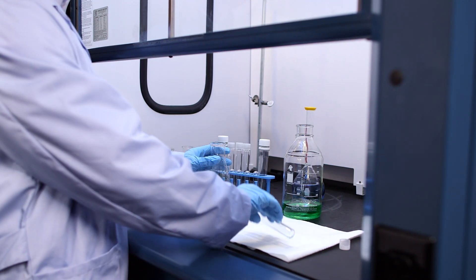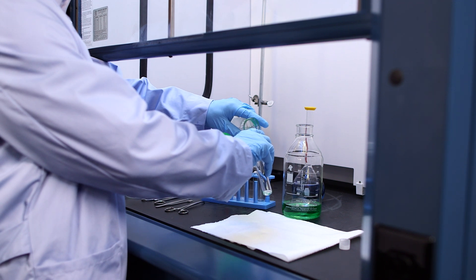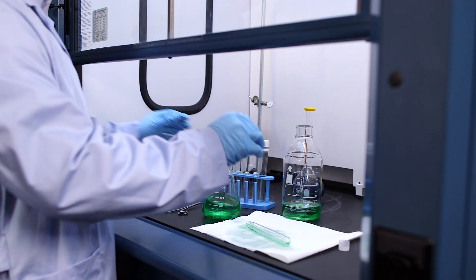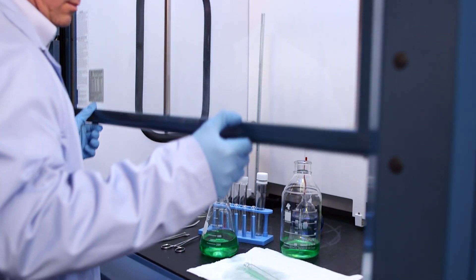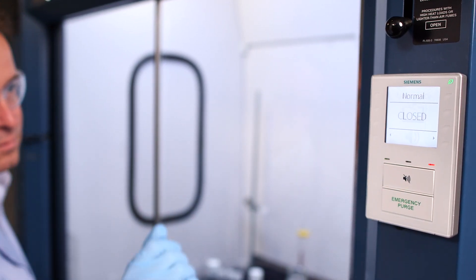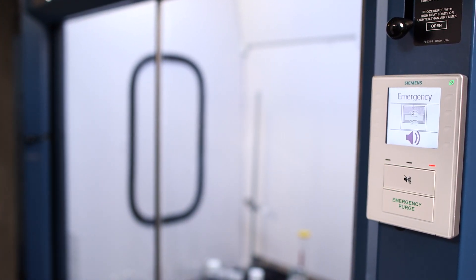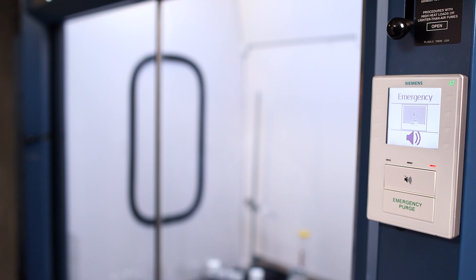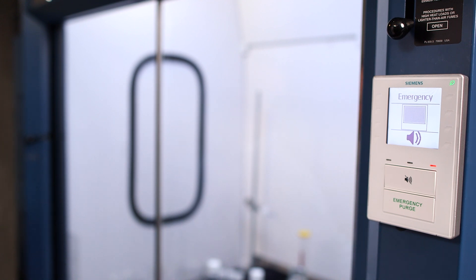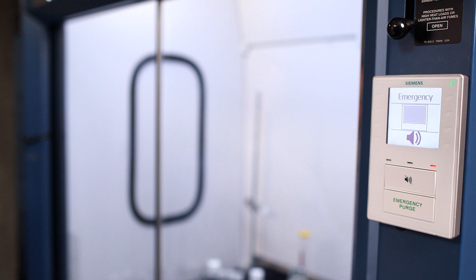Emergency purge mode maximizes exhaust to remove contaminated air. When an accident or special hazard occurs, the user closes the sash for protection and presses the emergency purge button to maximize airflow. The alarm sounds with corresponding readouts.